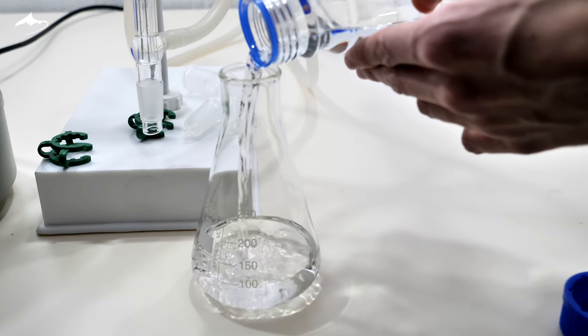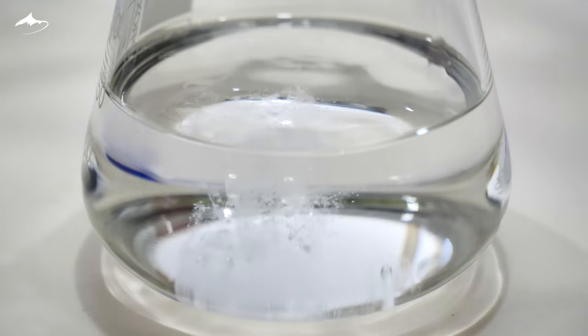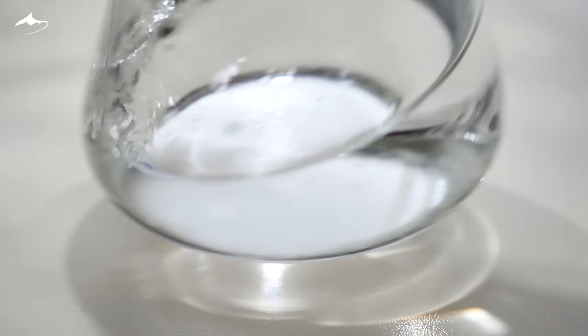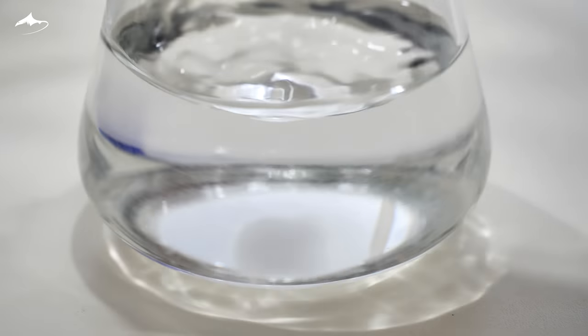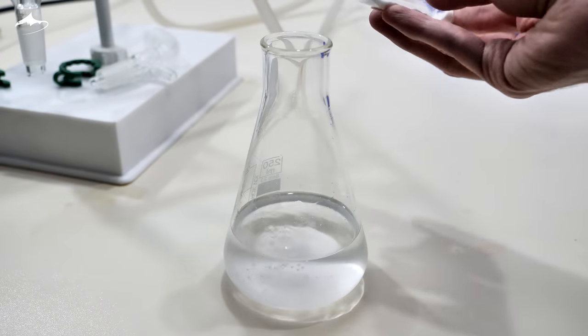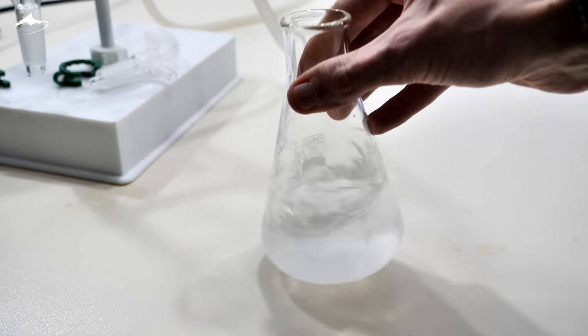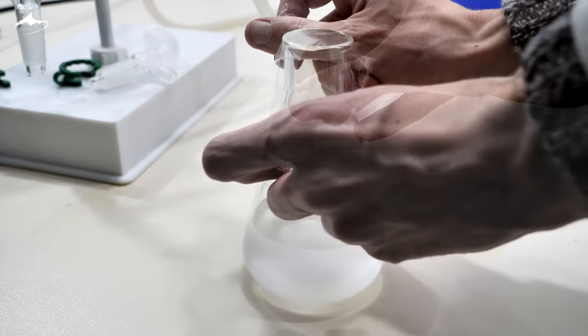I was pretty sure that my distillate contained water so I added some anhydrous sodium sulfate. This compound is often used as a drying agent for solvents as it forms a decahydrate trapping the water molecules present in the organic phase.